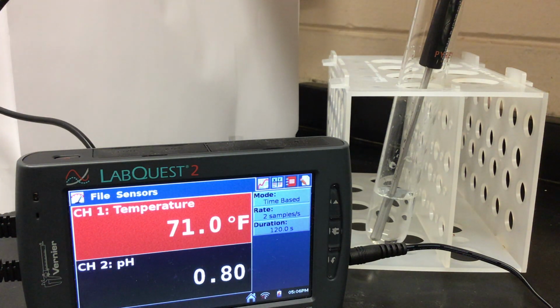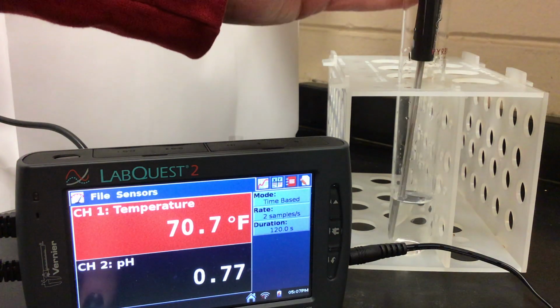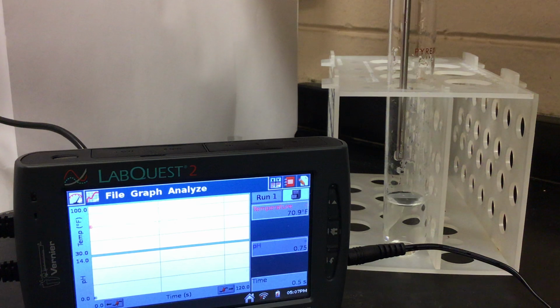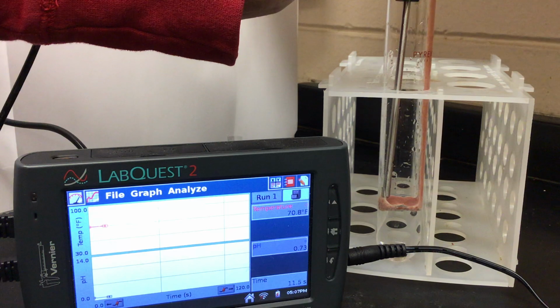We're going to do this with room temperature liver. So our only variable here will be the pH. And you should have recorded the 70.7 as our starting temperature. I'm going to add some pureed liver, which is again at room temperature. And we're going to check what is going on with this reaction.